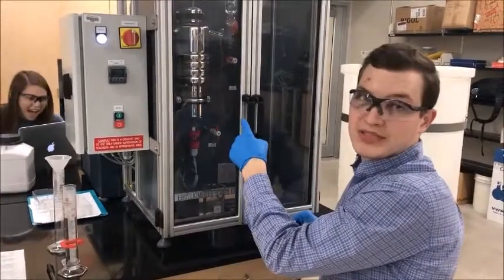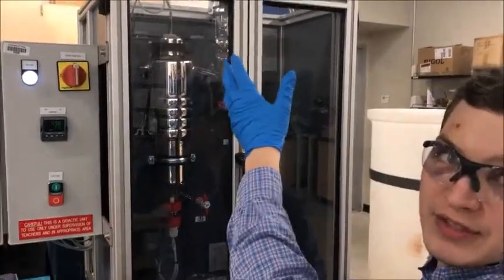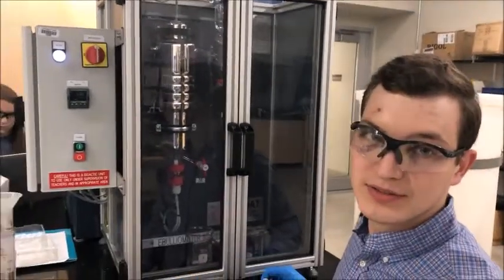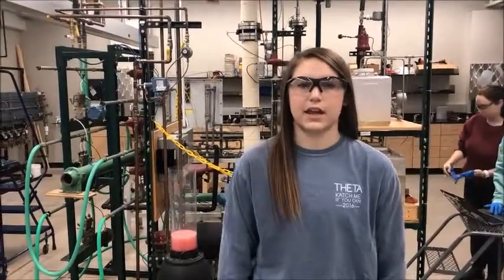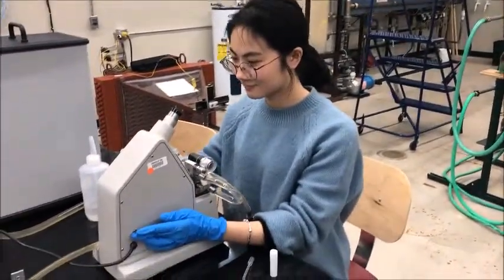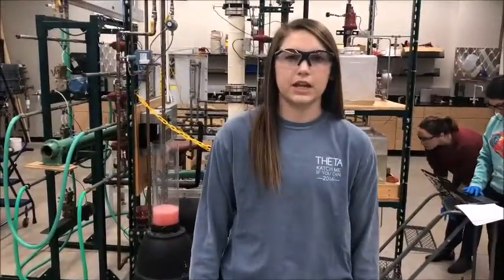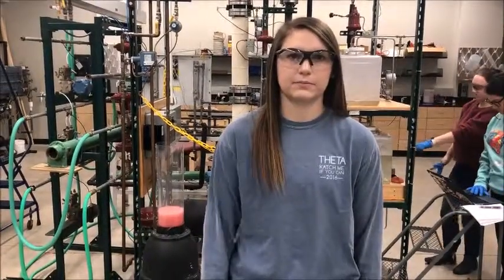Wait for the bubbles to stop being produced in the column, meaning no more vapor is coming off the top. So then you can open it up and pour in the rest of the fluids. Each sample is then analyzed using a refractometer as laid out in the composition analysis booklet. If the reading is above 1.3900, the solution must be diluted.